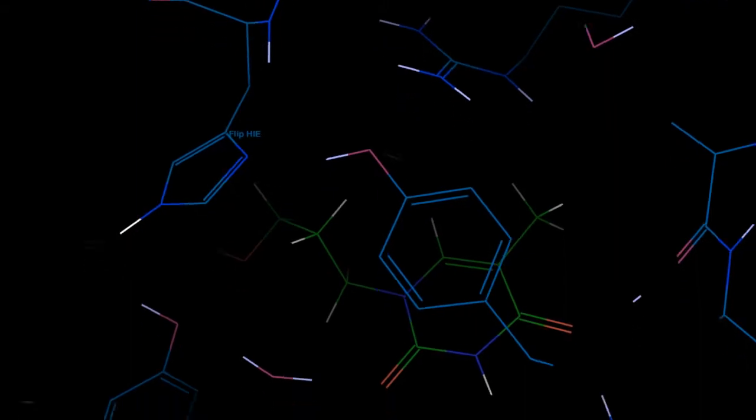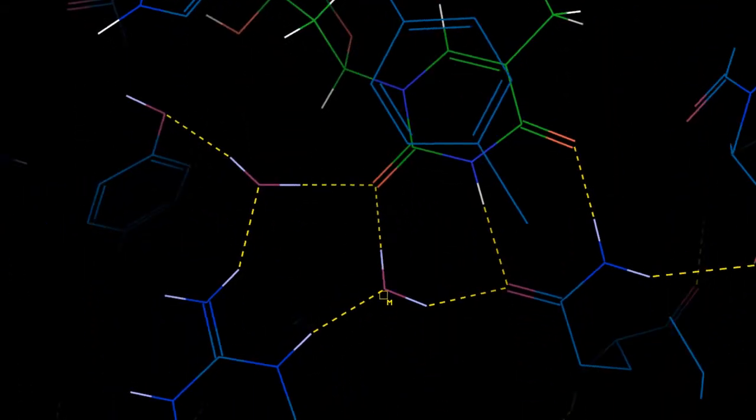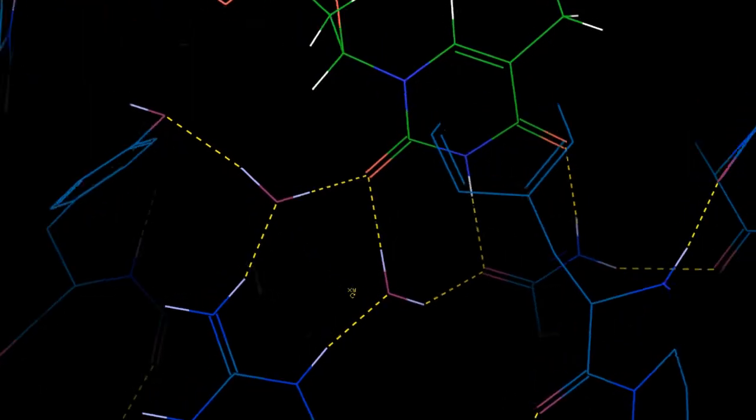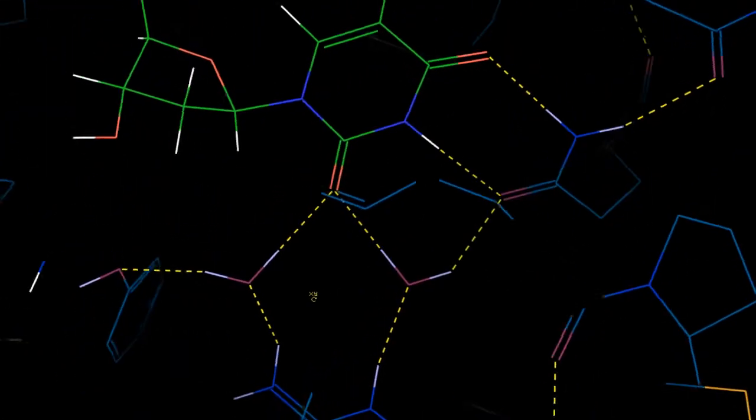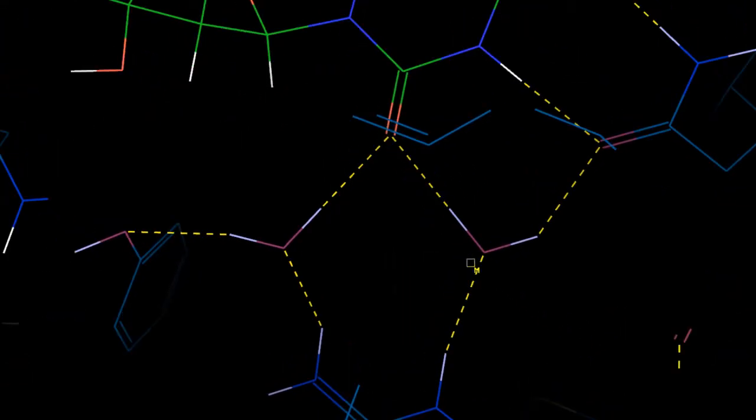Now notice we are left with a couple of water molecules here, bridging interactions between the ligand and the receptor. This may indicate we have waters critical in binding for other ligands other than this one. However, we won't know for sure right away. At the very least, this critical piece of information should warrant further investigation as to whether we want to include these waters when virtual screening for new ligands, either by running tools like Bioluminate's Consensus Viewer to identify conserved waters for this target, or to use more advanced simulations to estimate the water network and thermodynamics like running WaterMap.